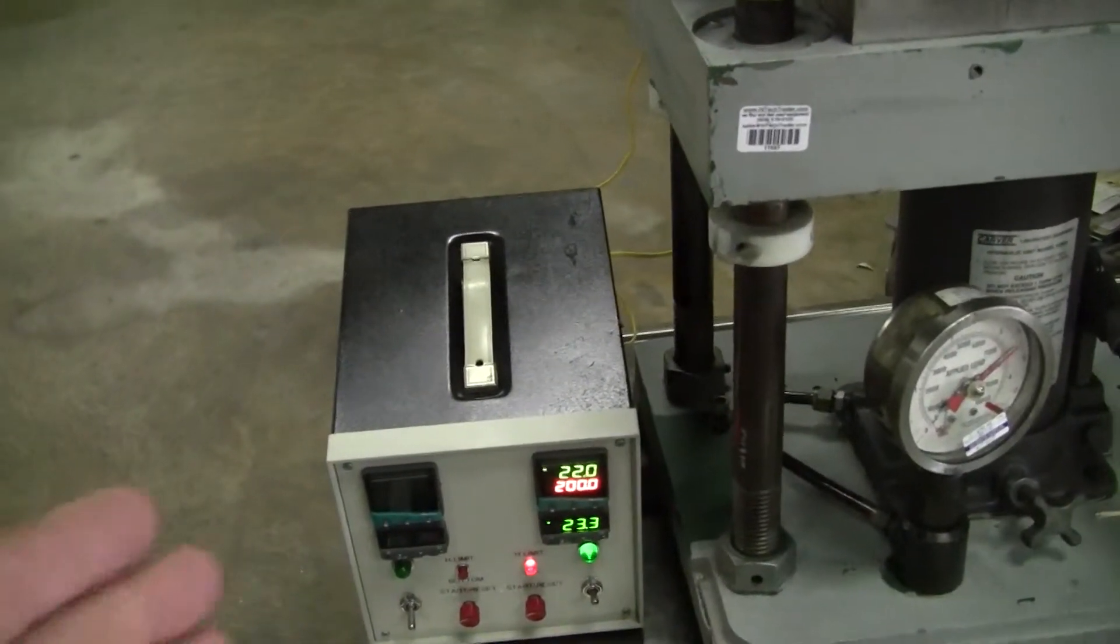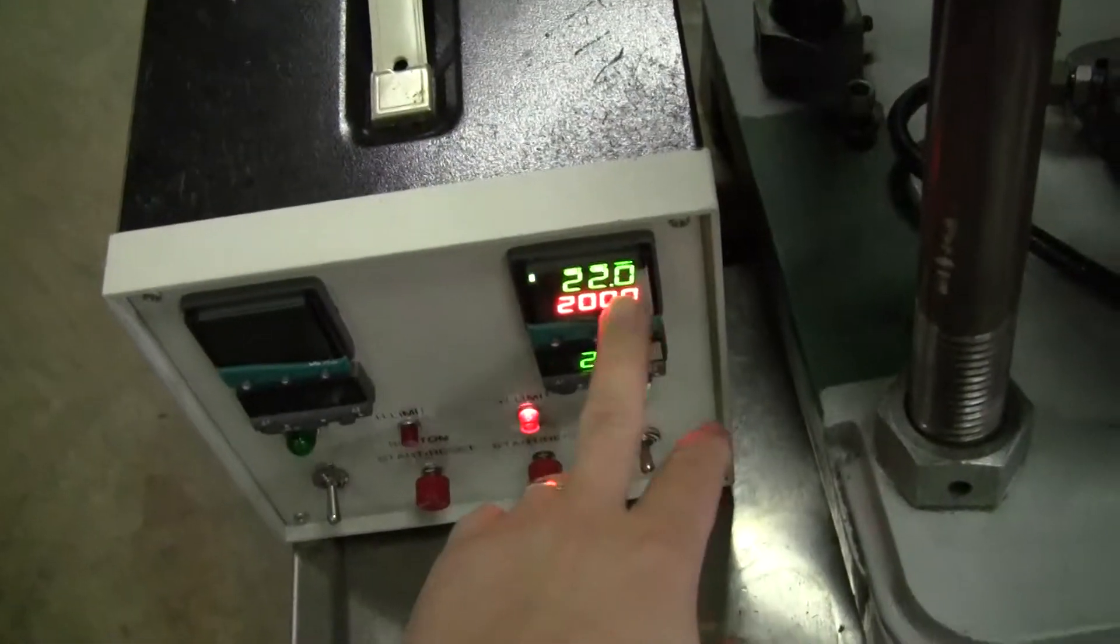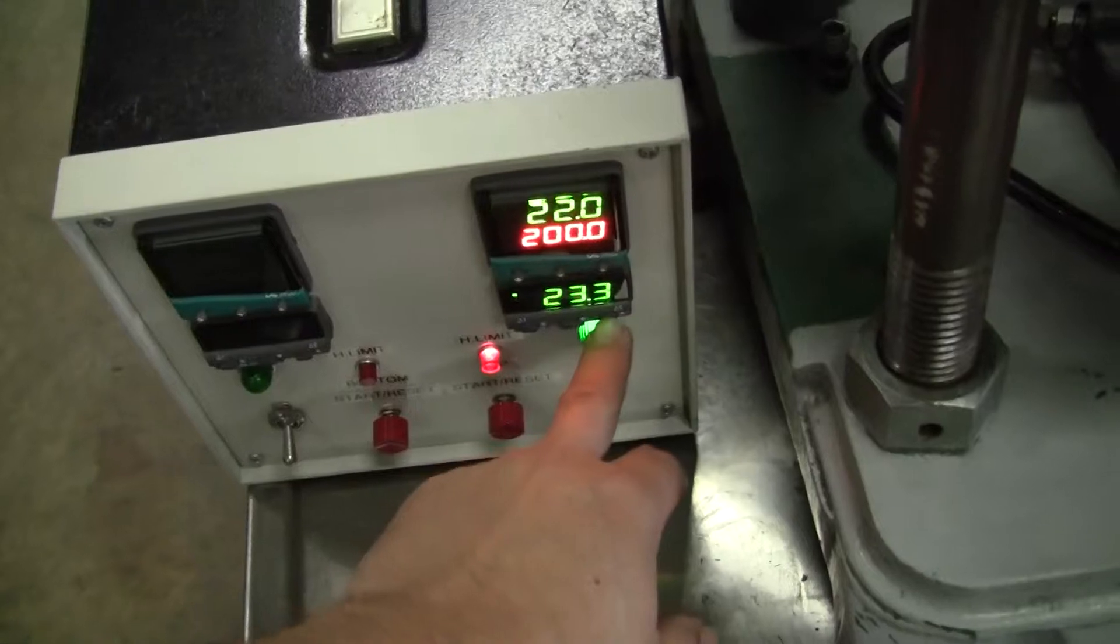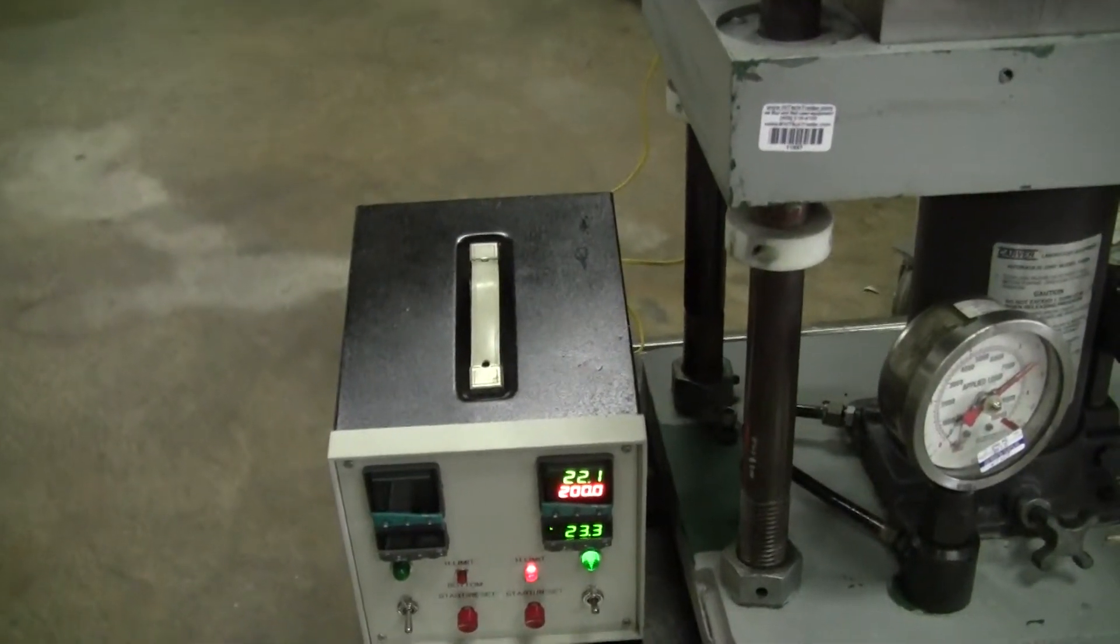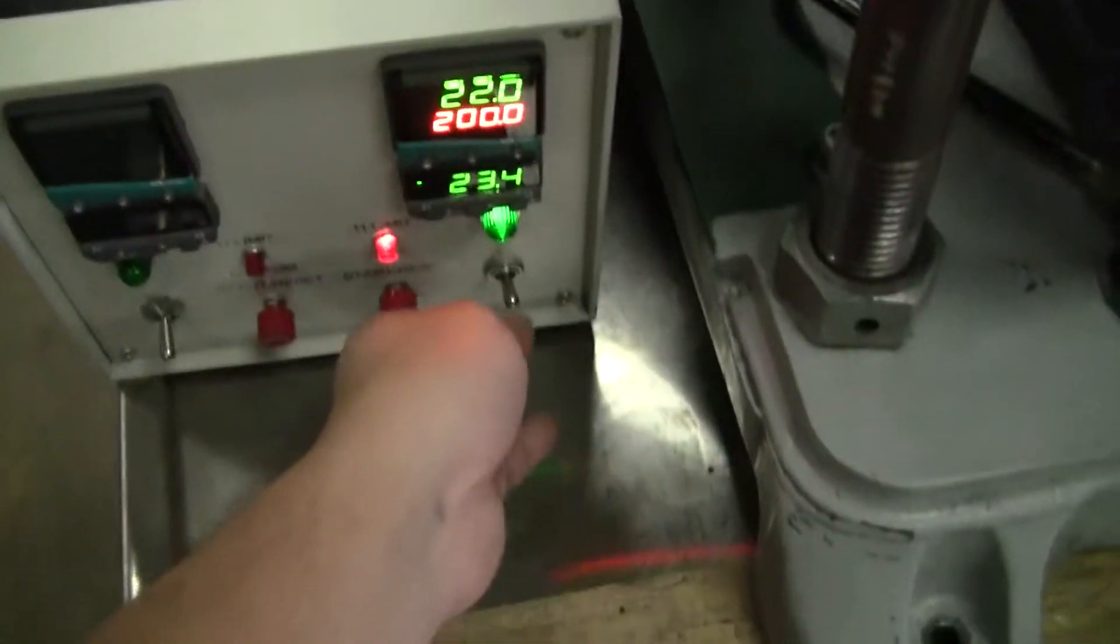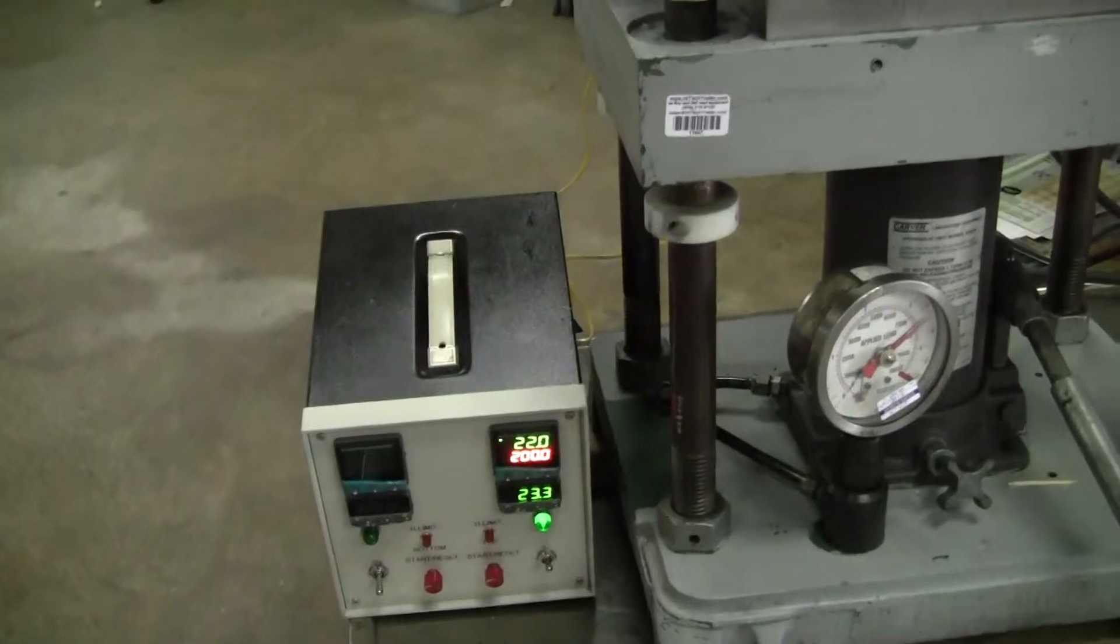So even though it's flashing, this allows you to enter the set point temperature, and then that'll be the over temp. And then it'll actually start generating heat.